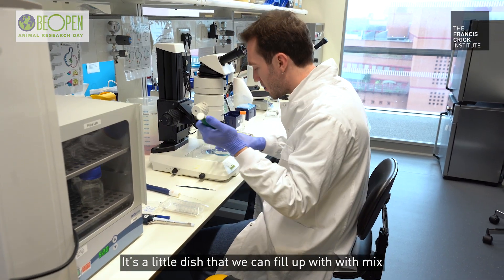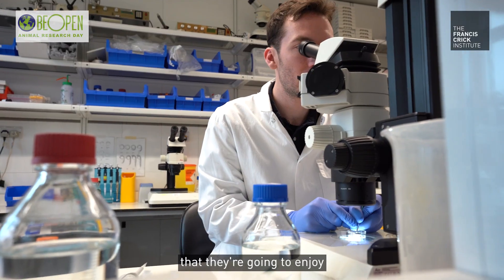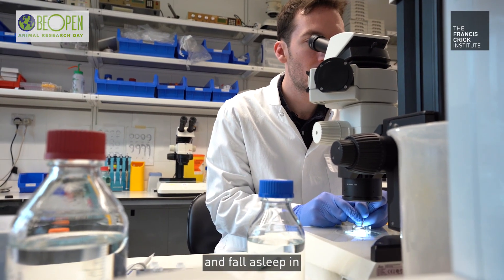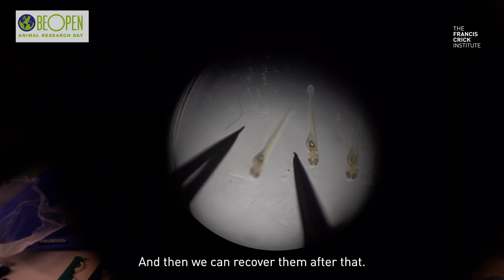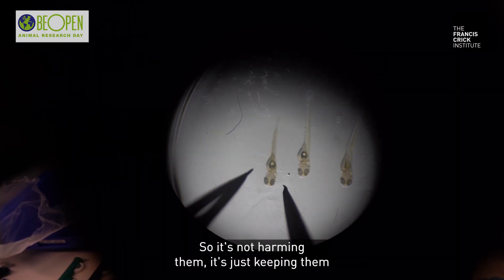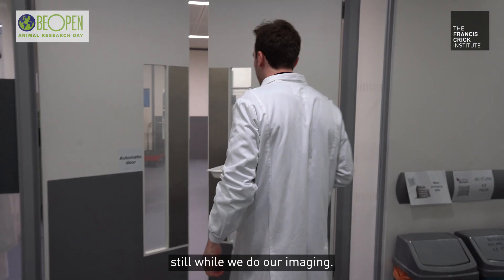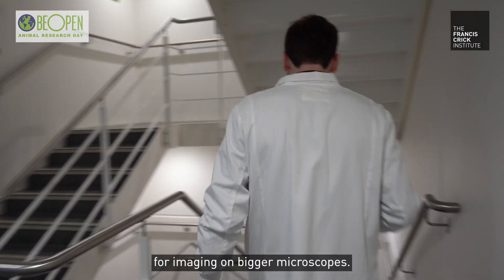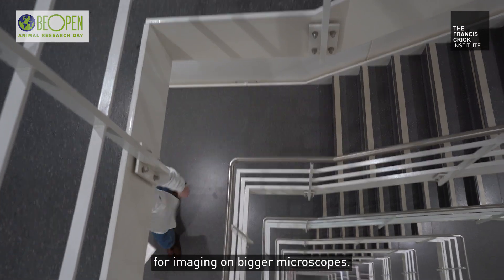It's a little dish that we fill up with a mix that they're going to enjoy and fall asleep in when we put them on the microscope — that's all. We can recover them after that so it's not harming them, it's just keeping them still while we do our imaging. And this allows us to prepare them for imaging on bigger microscopes.